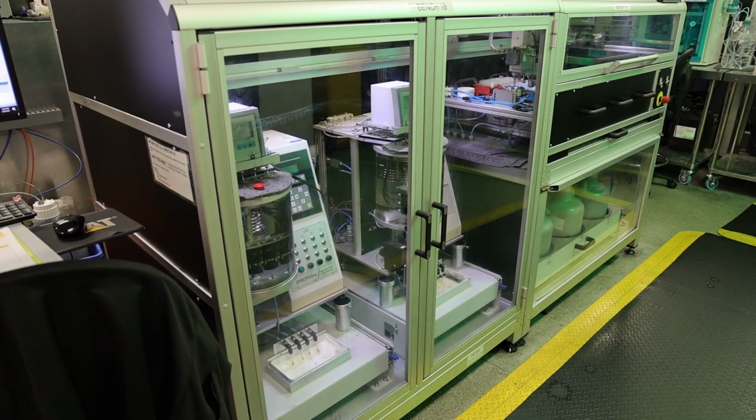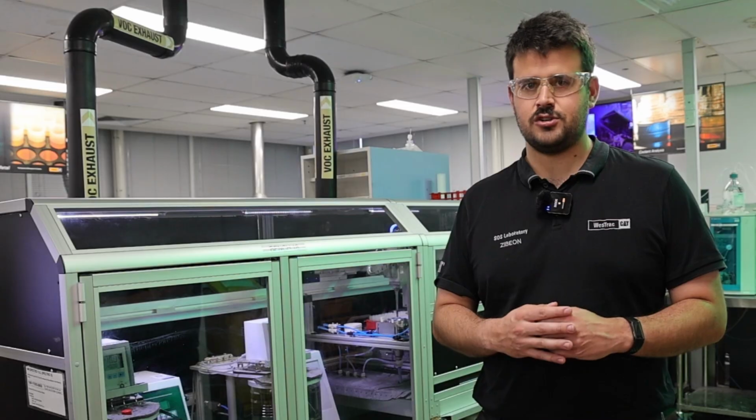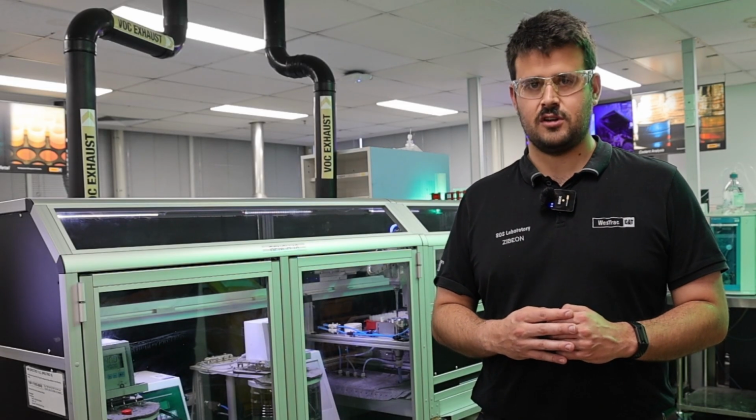As it flows down that tube, it hits a whole bunch of lasers which record different times, which sees how fast it flows through that tube, and then at the end it's able to do some clever calculations in the background and produce that viscosity result for you.